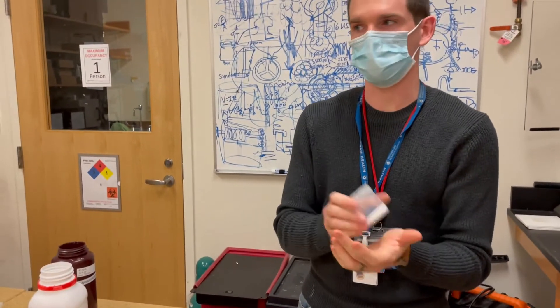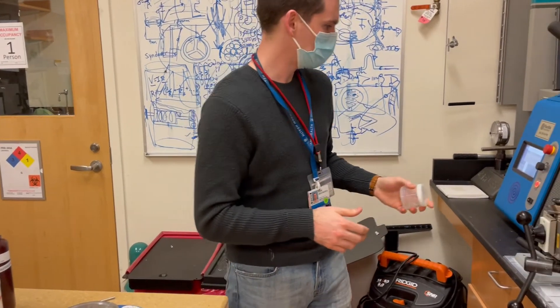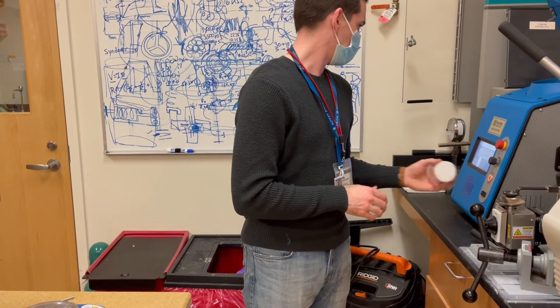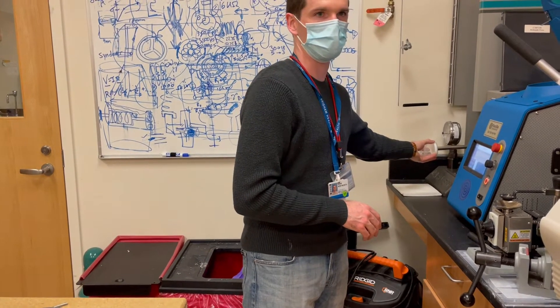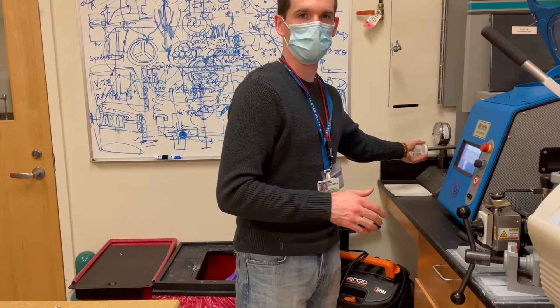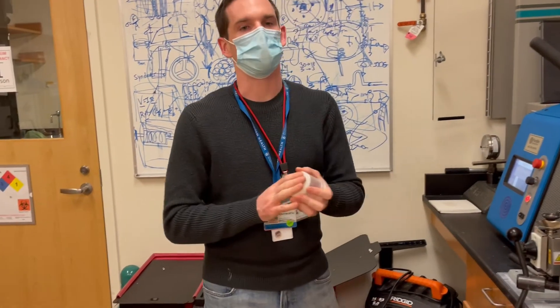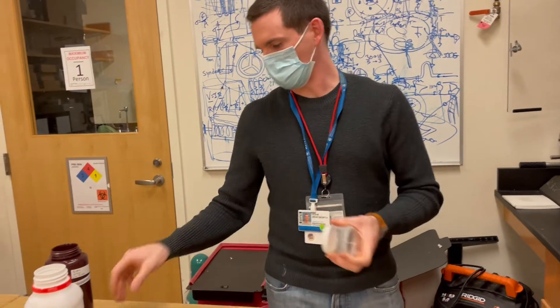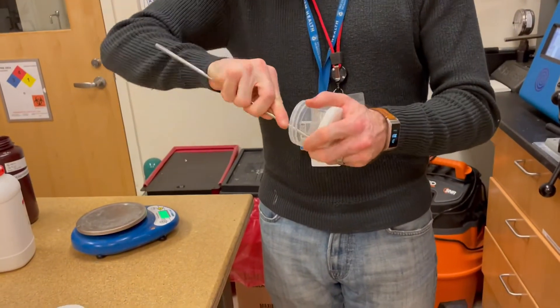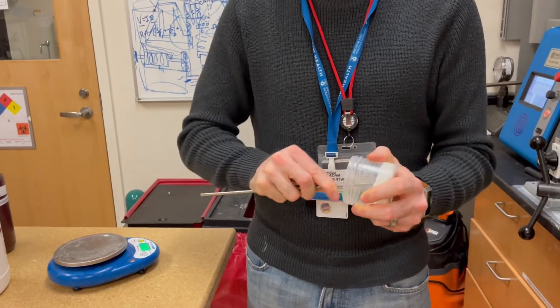At this point it's still pretty warm — you can feel the bottom of the cup, there's a lot of heat. Ideally what we would do is cool it off until it's a workable temperature, which would be like 70 to 80°C. At that point you would take a metal rod like this and begin to gather it inside the cup like a dough.